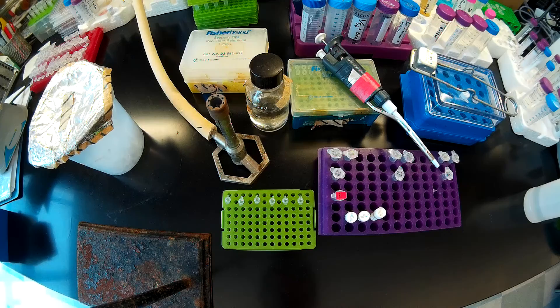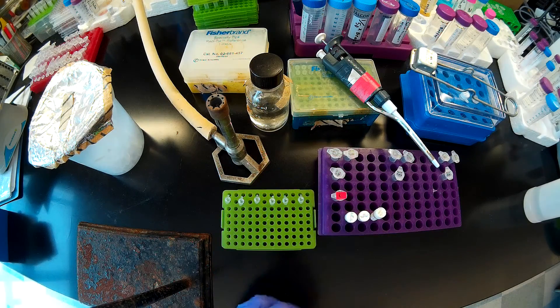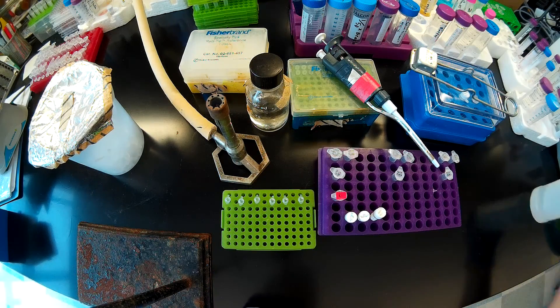In this video we're going to learn how to set up six PCR reactions from a PCR master mix.